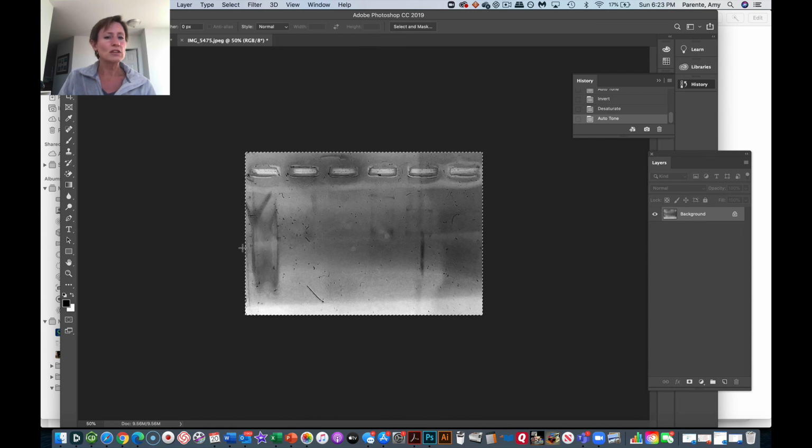Now, don't ever really write anything on your gel. If you're printing this out or you have some white space, or if you're doing this on an iPad or a tablet, go through and draw a little arrow and say, oh, at this spot, this is what we'd expect to see. Any bands that you do see, hypothesize, what do you think they are? I'm less concerned that you get this 100% right than that you just have practice doing this. Okay, so that's a little bit on how to annotate your gel.